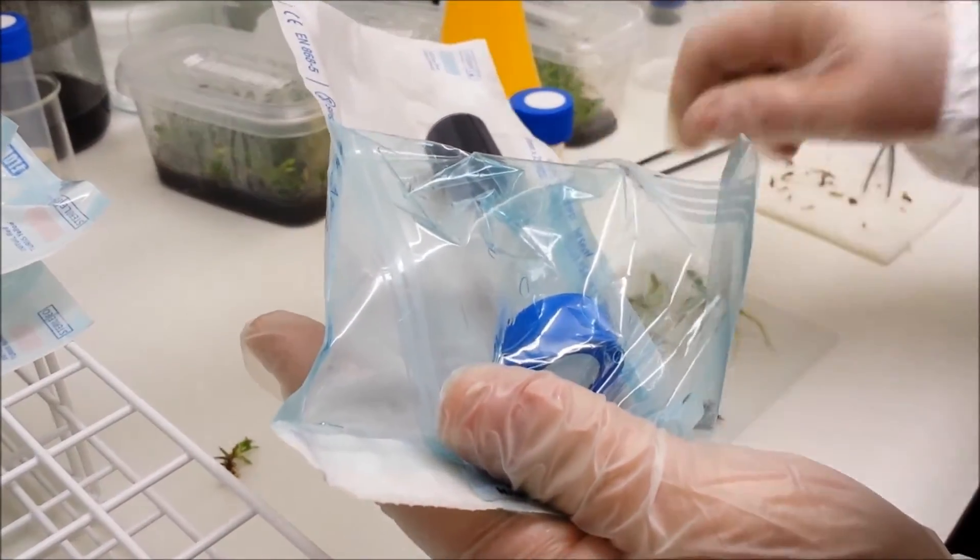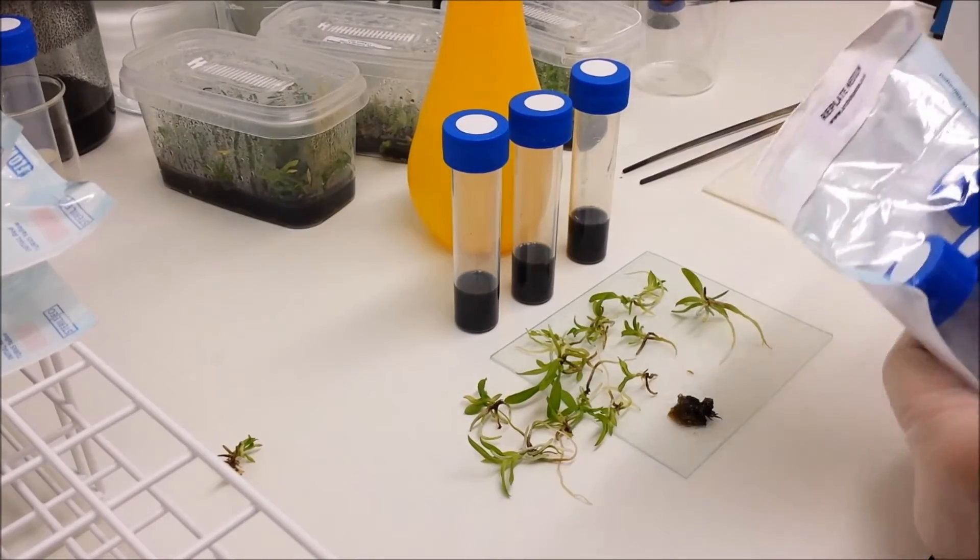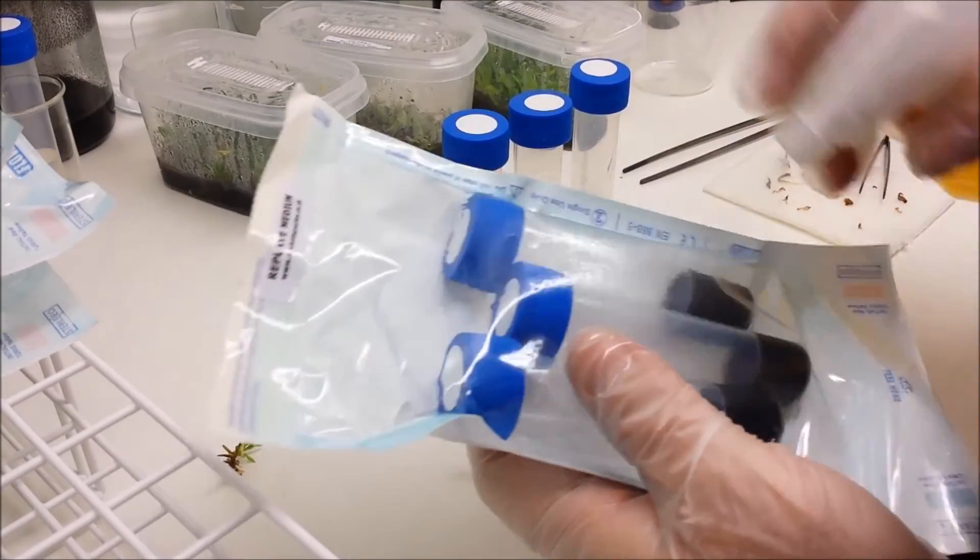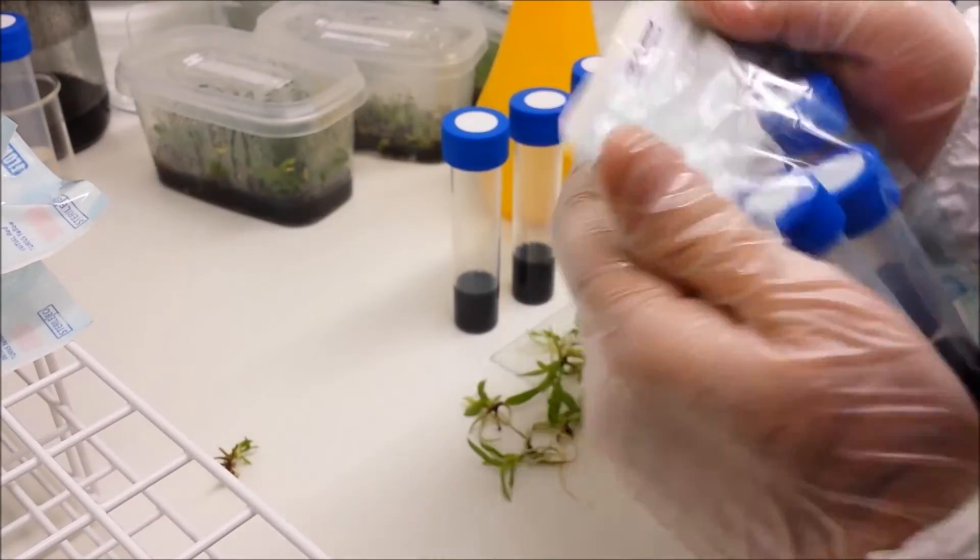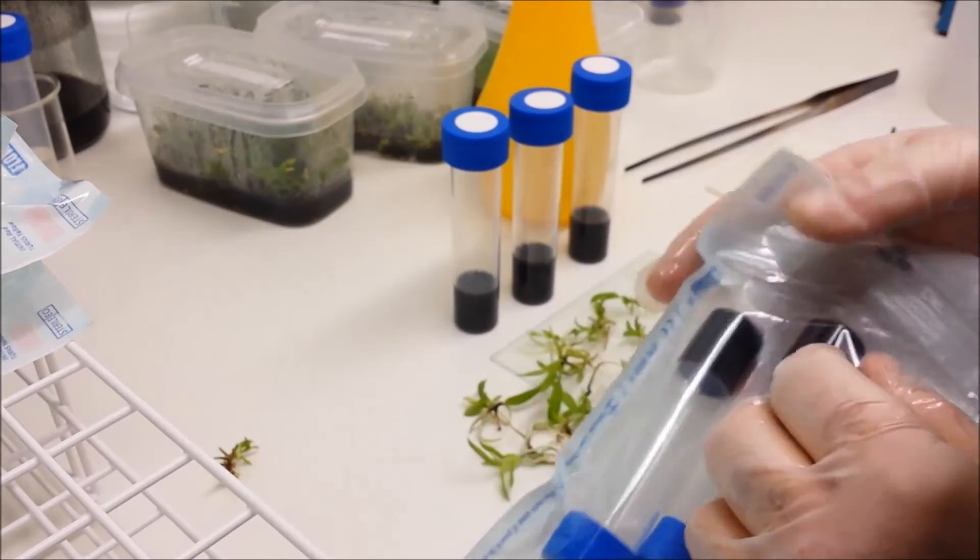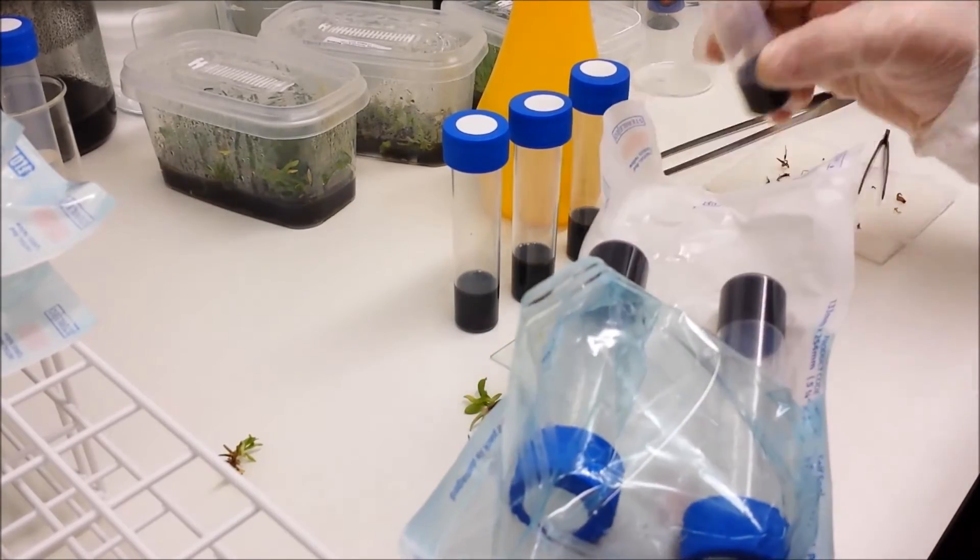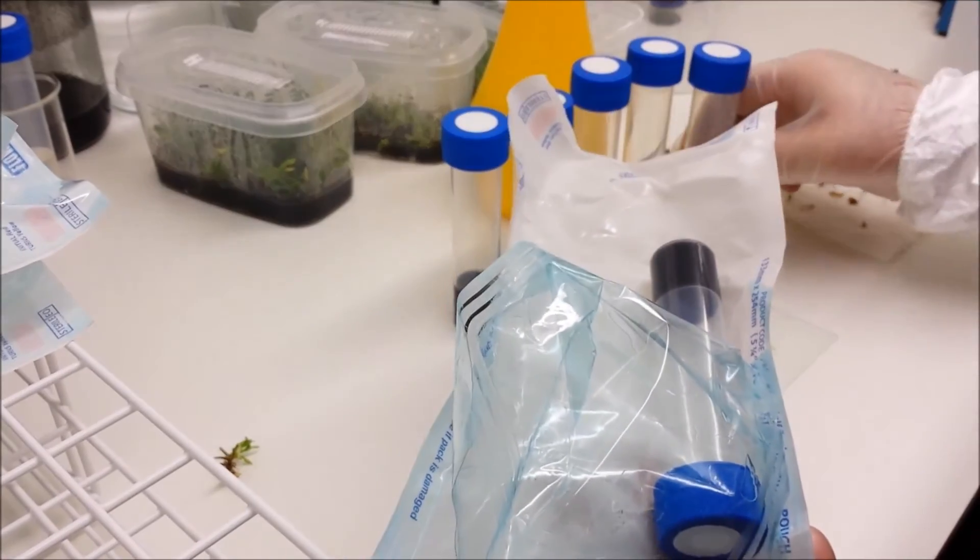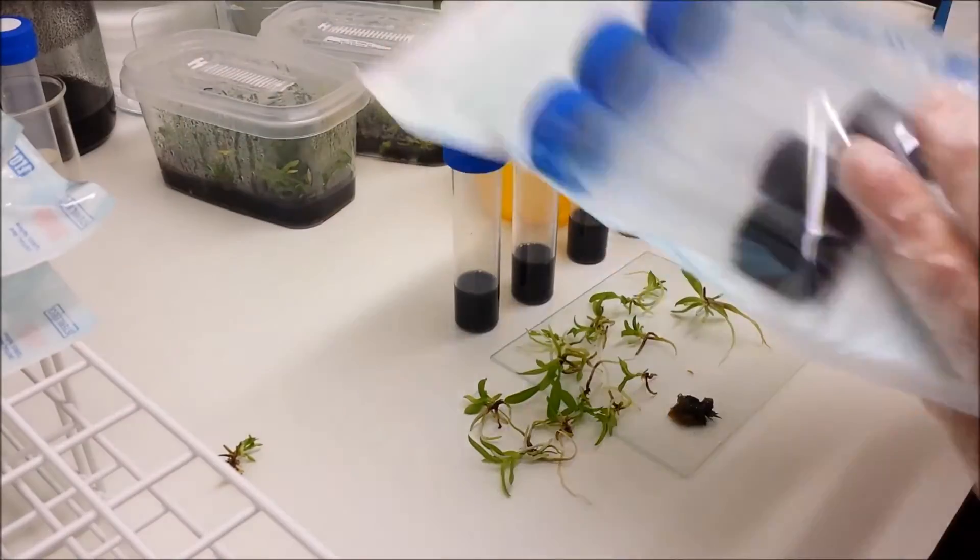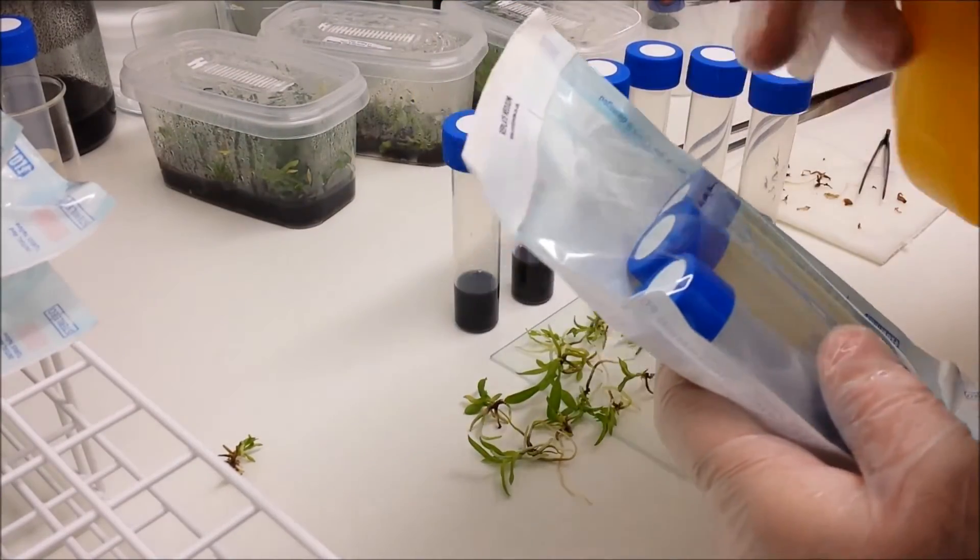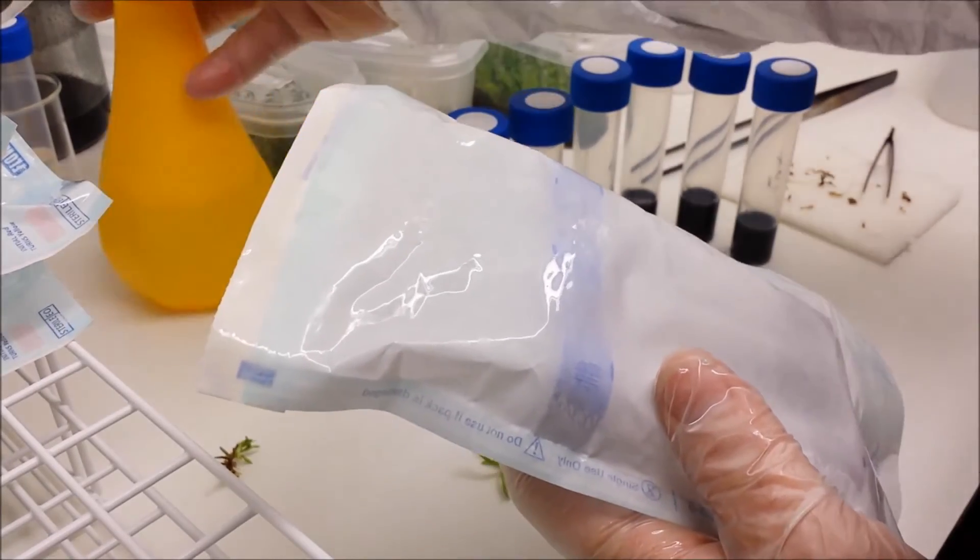Inside the packets and the actual tubes themselves are already sterile, as is the atmosphere inside the packet. So there's no need to spray them. But again spraying it with IPA. IPA by the way is only pretty cheap material, it's about 15 pounds for I think you get a gallon. So it's not an expensive material. And it's not the kind of alcohol that you drink either. So don't be thinking I'll have it with a bit of coke because that will not do you any good at all. And you can't use vodka, but I suppose you could, but the temptation would be to lick the bottle. So we'll just use IPA.